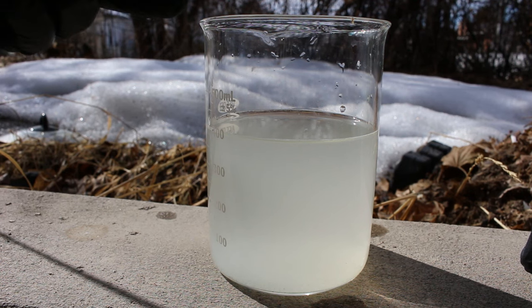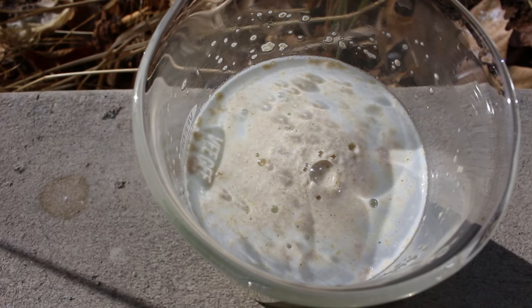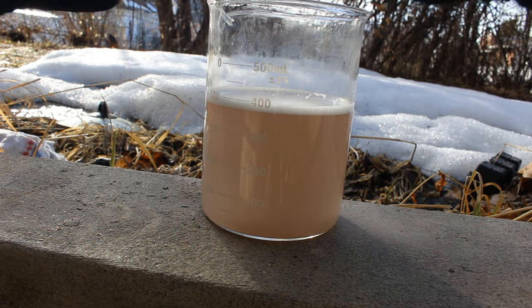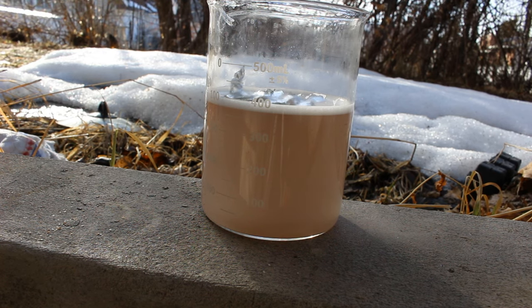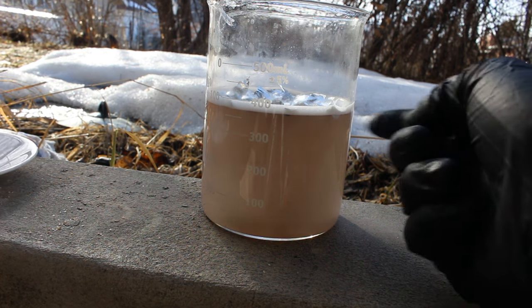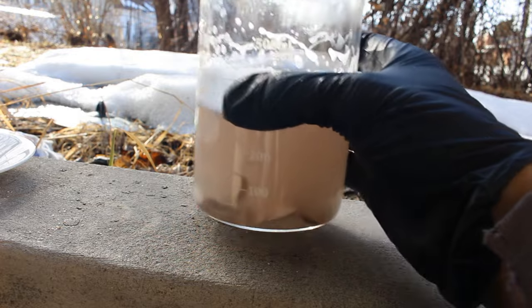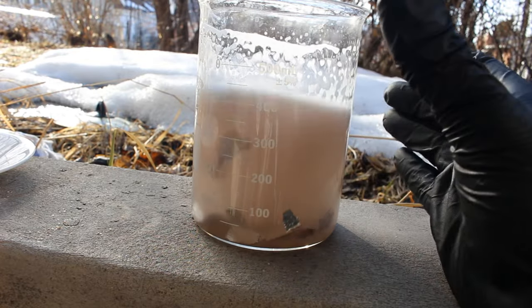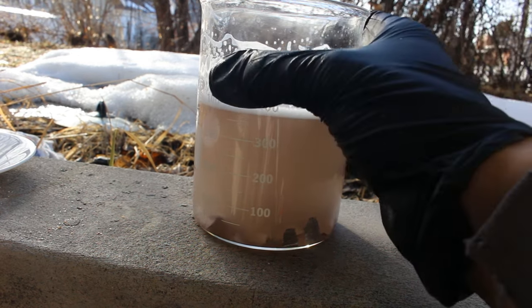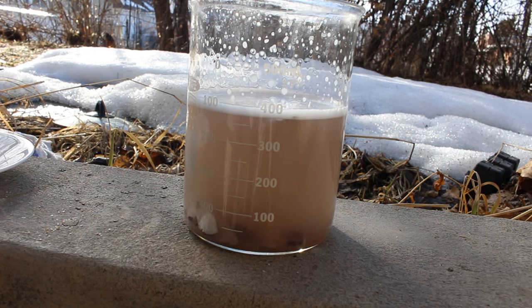So I'm just going to add a little bit of yeast here, and the yeast will catalytically destroy the peroxide. See the bubbles of oxygen coming up as the yeast destroys the peroxide. I couldn't find any zinc powder because I'm not back at the ranch, but pieces of aluminum foil ought to do just as well. The idea here is the aluminum will actually replace the gold in solution — it'll make aluminum dissolved in solution and the gold should fall out as a solid. The little bit of potassium hydroxide in there should actually begin reacting with the aluminum, which will help dissolve away that aluminum oxide coating and expose the fresh aluminum to the gold. This is probably going to take quite a while for that gold to fall out, so let's go do something else.